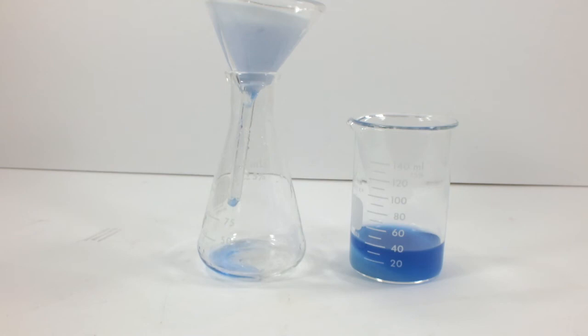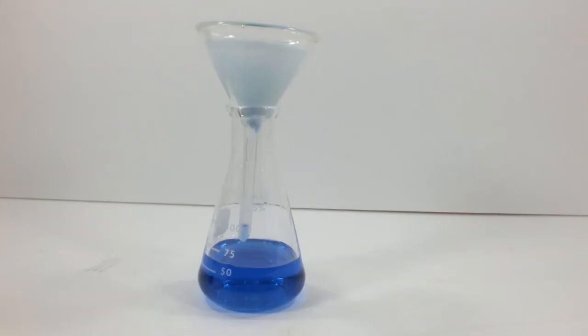Those are the only two barium salts I have in stock though, so that's all I can try. I didn't wash the precipitate at all, by the way. Given the obvious solubility in water and unknown solubility in acetone, I figured it wasn't worth the risk.